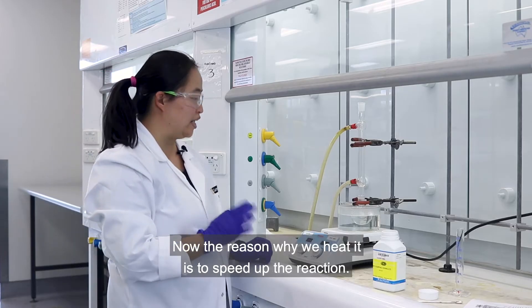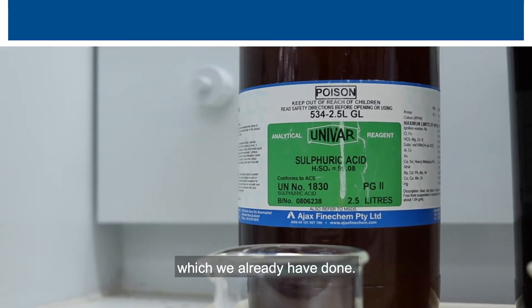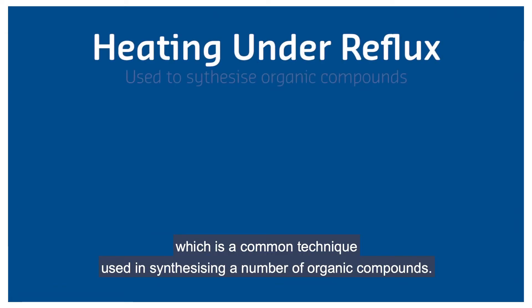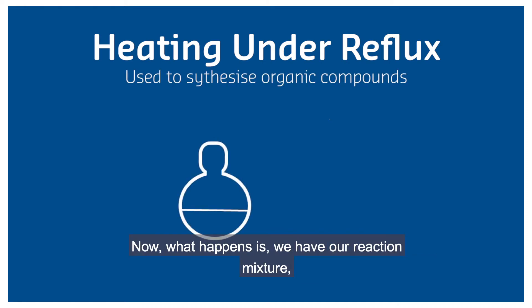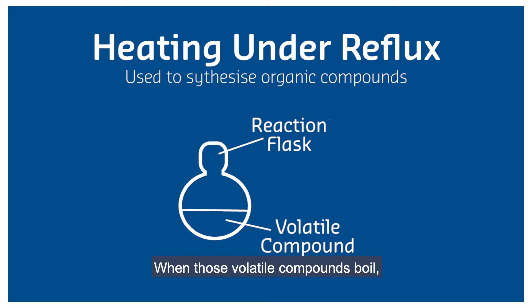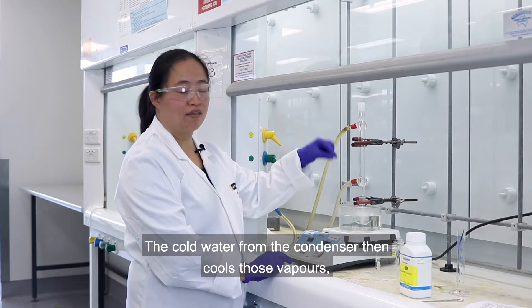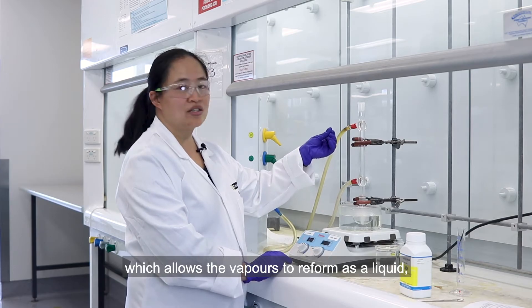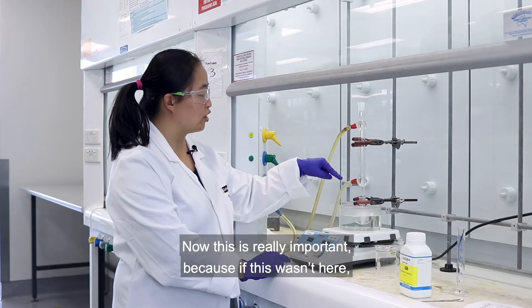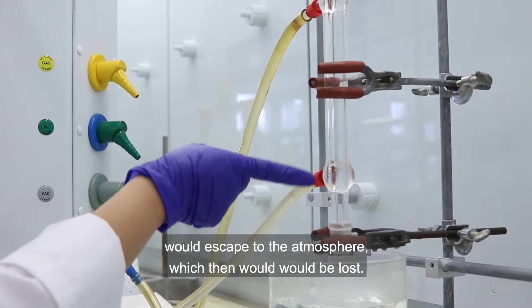We just have to lower our reaction into our hot water bath flask and that's when it's going to be heated. The reason why we heat it is to speed up the reaction. Another way to speed up the reaction is to add a catalyst, which we've already done. Heating this way is called heating under reflux, which is a common technique used in synthesizing organic compounds. Our volatile compounds in the reaction flask produce vapours when they boil, which rise up the condenser. The cold water in the condenser then cools those vapours, allowing them to reform as a liquid and go back into our reaction mixture. This is really important because otherwise our reactants and products, which have low boiling points, would escape to the atmosphere and be lost.